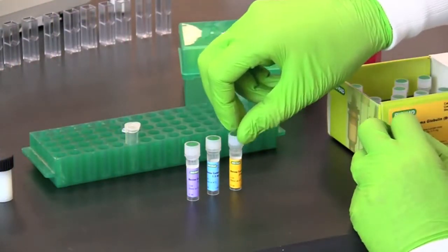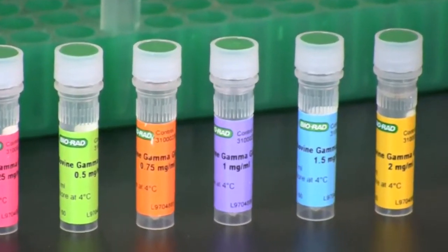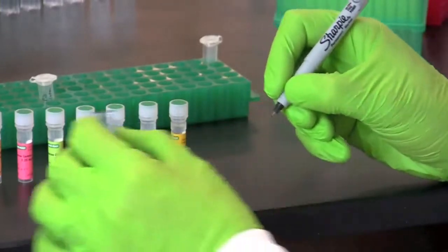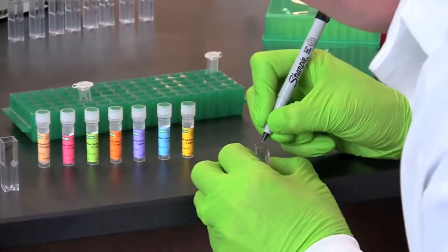Next we will set up protein standards. See your protocol for the correct concentrations. Label a cuvette for each standard and mark it with the corresponding concentration.